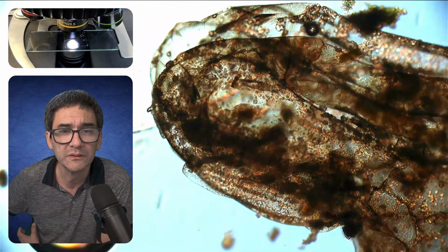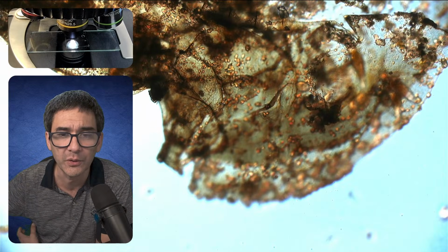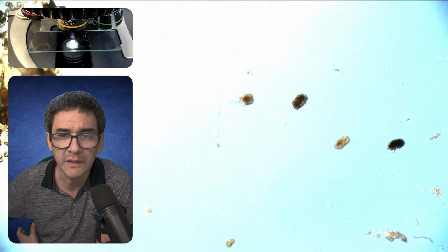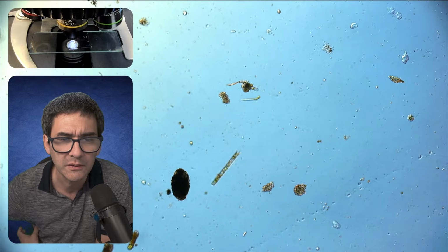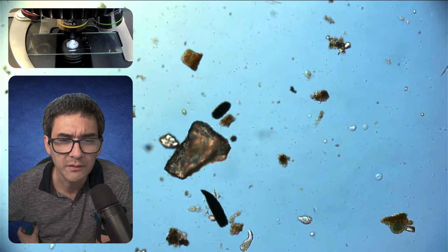So simply to show you, there's lots of stuff going on here. Sometimes I think I might have also seen a couple of diatoms as well. Let me check.